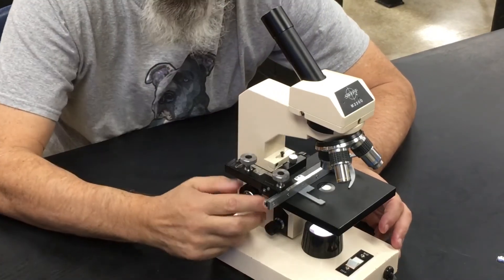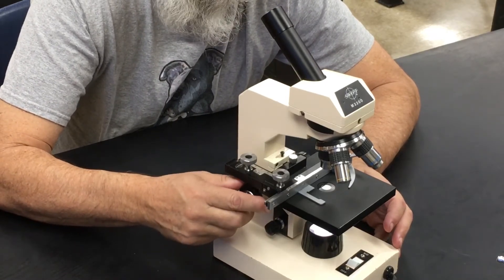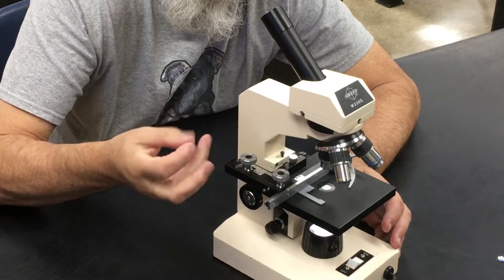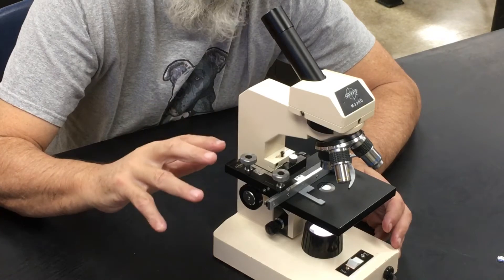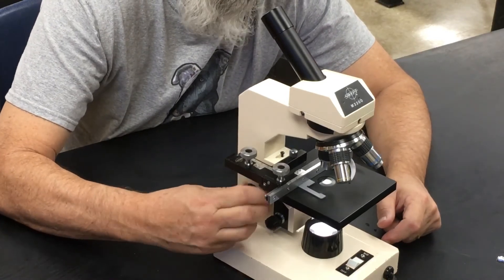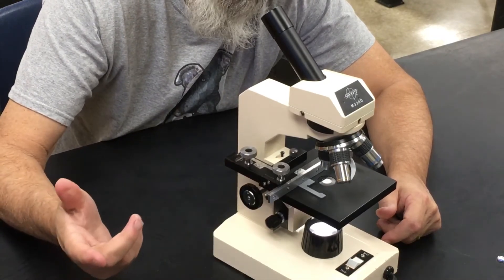This is called the body tube. The focus knobs are this one and this one. This is called the coarse focus knob — 'coarse,' like sand with little pebbles and chunks of rock, meaning it doesn't adjust very finely; it adjusts big movements. See how the stage moves up and down quickly when I turn it — that's how you start out when focusing.